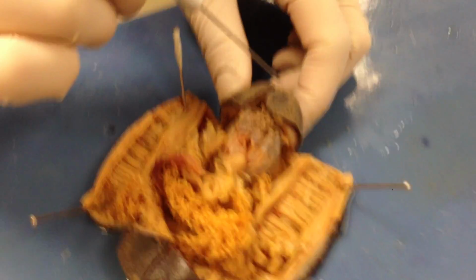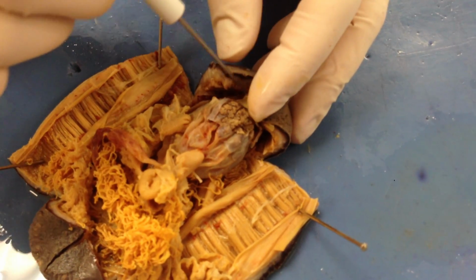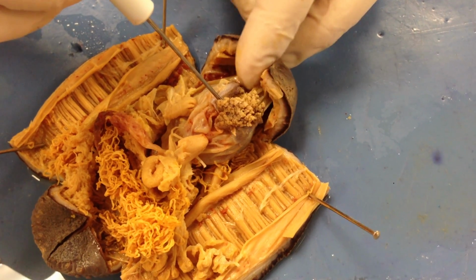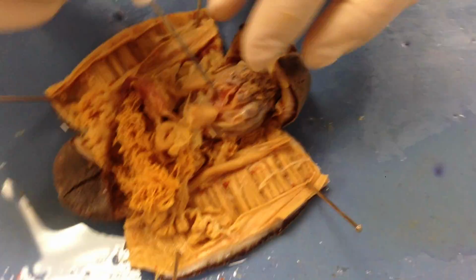If we go back up to the mouth region, we head in as we cut it open. We're going to cut through the mouth and into the pharyngeal bulb right here. And it contains, what you can see here, are the feathery tentacles used in feeding. This would be the pharynx, or the tube that runs down here.